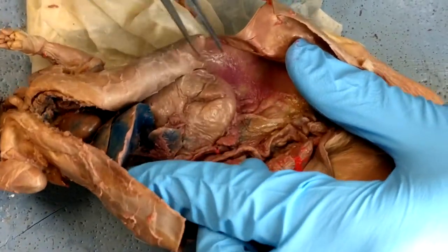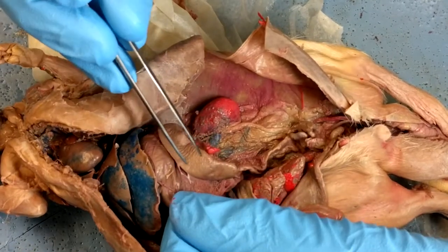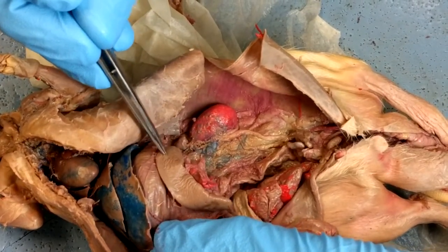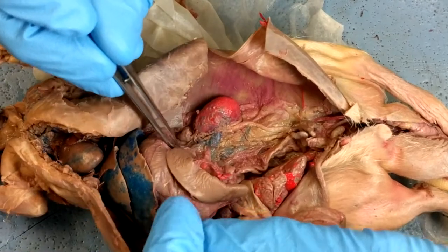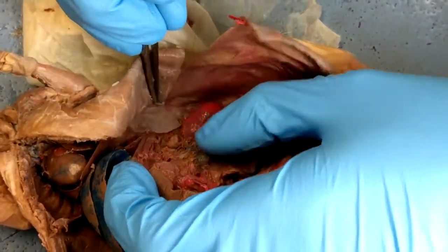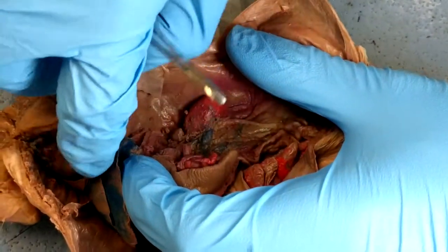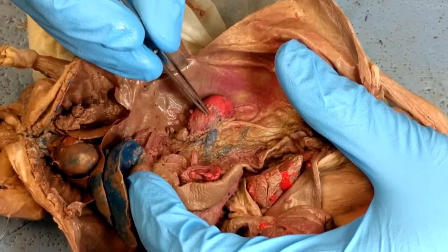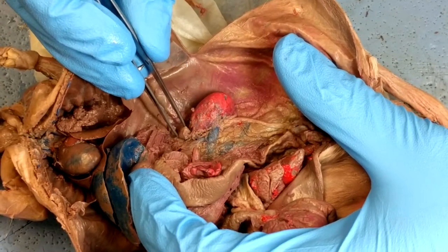Moving on — we push and flip the stomach over. Here you can see the spleen. And right above the kidney is where you find the adrenal gland.